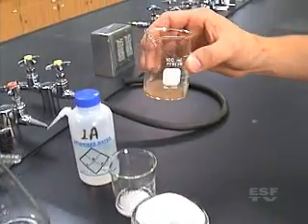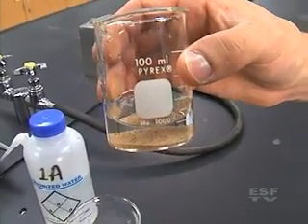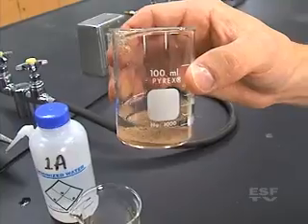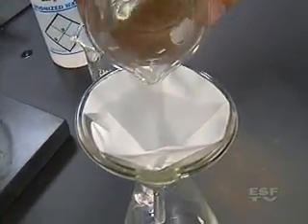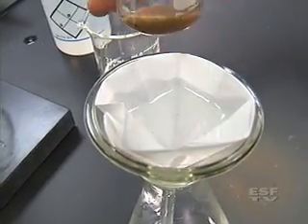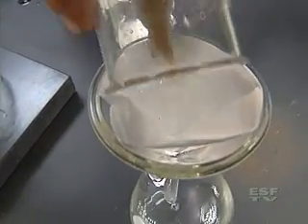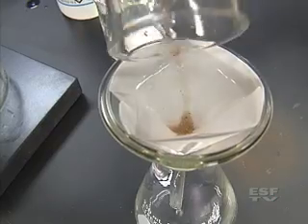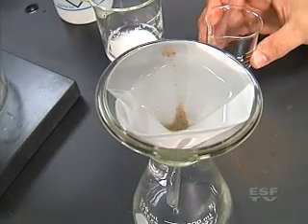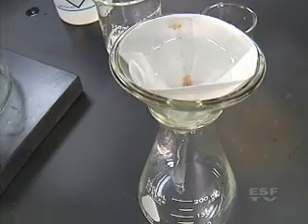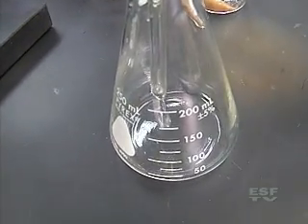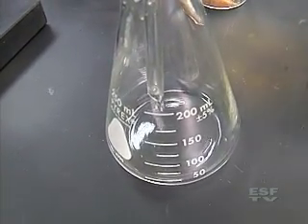What I have here is just a solution of sand and water and I'm going to try to separate those using gravity filtration. And as I stir it up I'm going to pour the whole thing into solution. In this case getting that sand right into the filter paper. And you can see that this filters pretty quickly. The sand stays at the top and through the bottom you can see that the water, the clear solution, is just draining through.